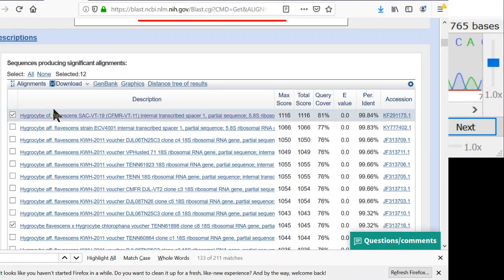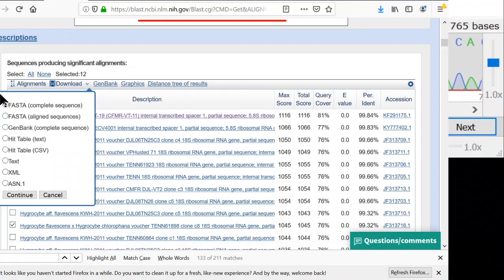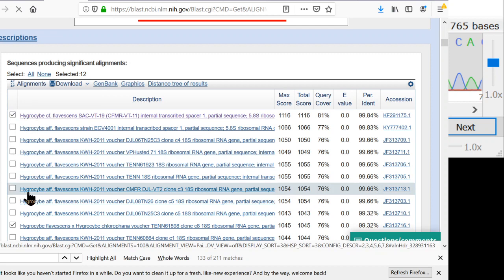We could just select all, and then we have 100 sequences in our tree. That would take a couple more minutes to generate. So here we got 12 sequences selected. So I will download that. And FASTA is the correct format to download this in.